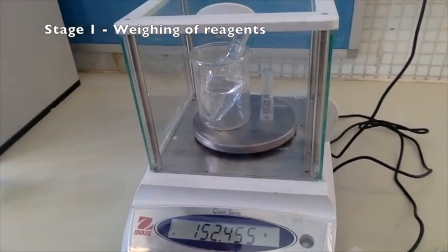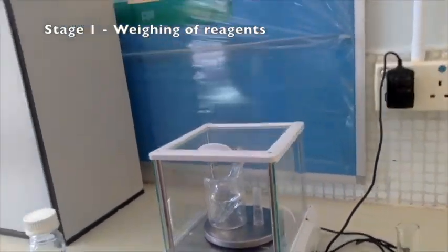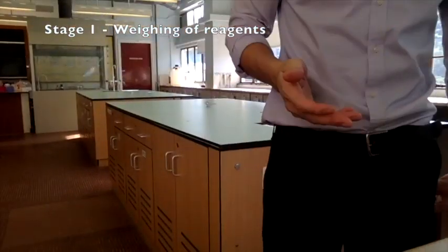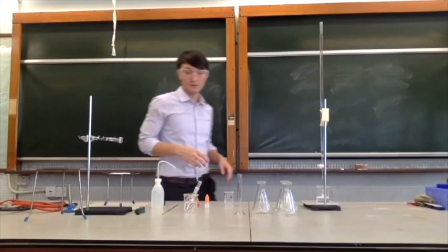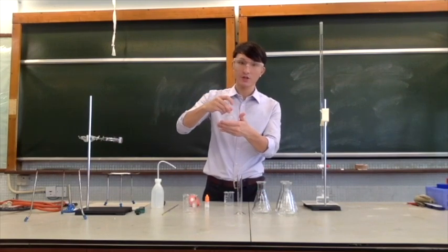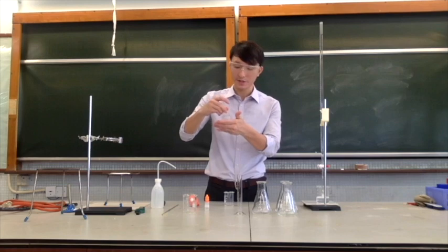Okay, I think that should be okay. So make sure you put down the initial amount of the acid and alcohol. Now, after you have weighed your sample here, make sure you shake it thoroughly so that they are well mixed.